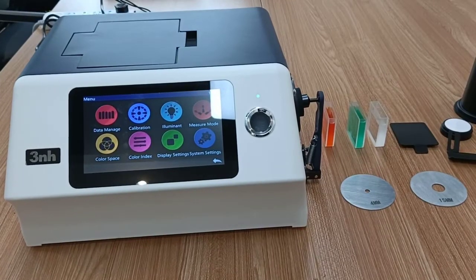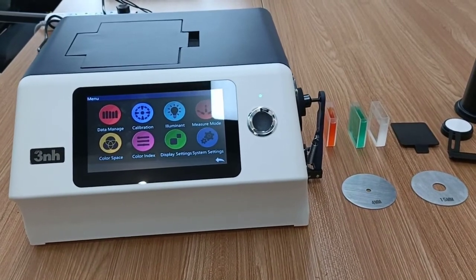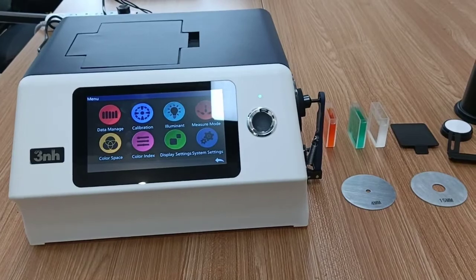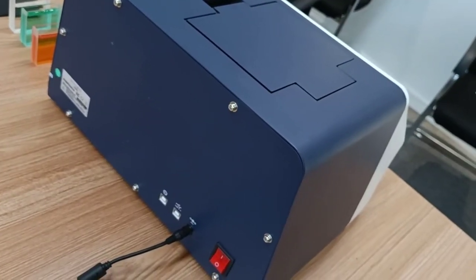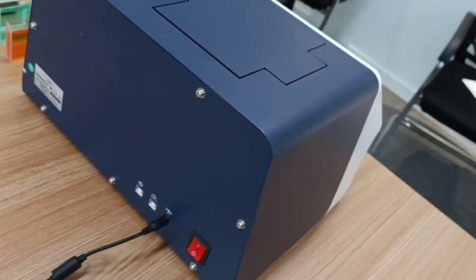Let me show you how to operate the desktop spectrophotometer YS6060. First, let's take a look at the external structure of the instrument.